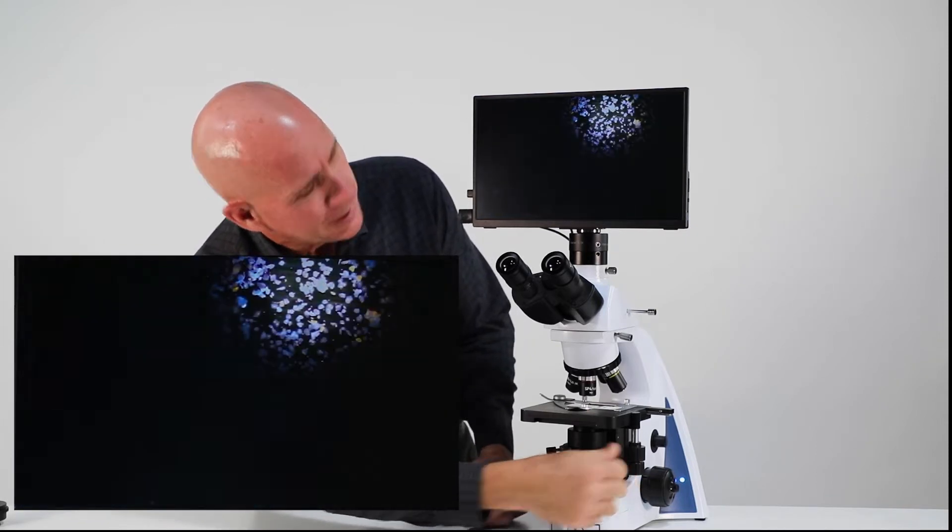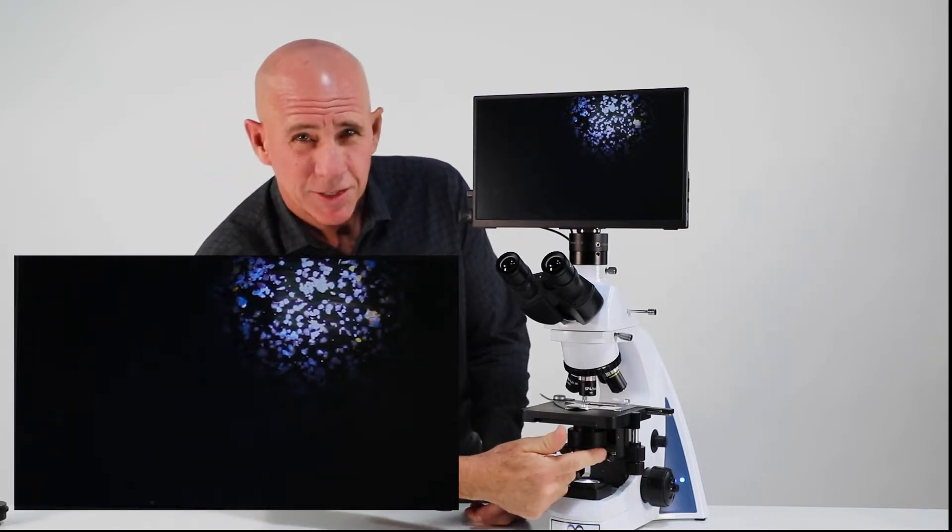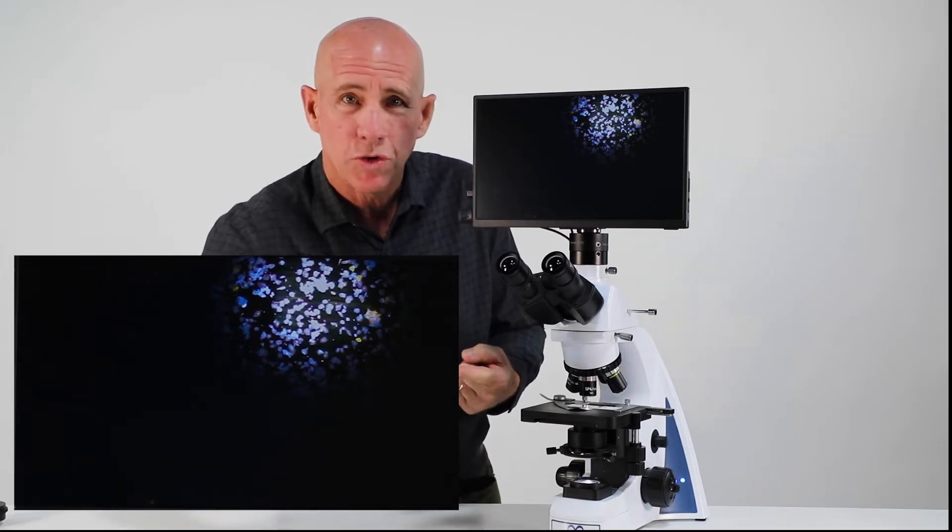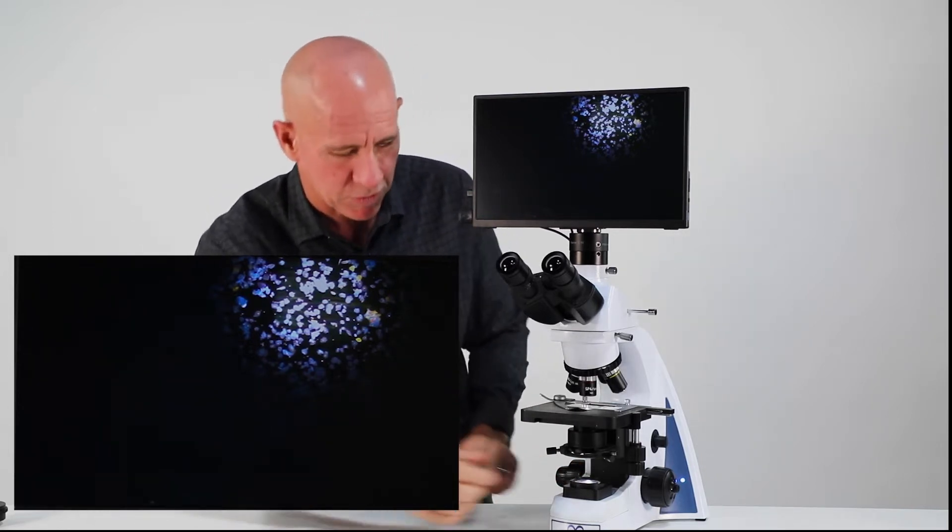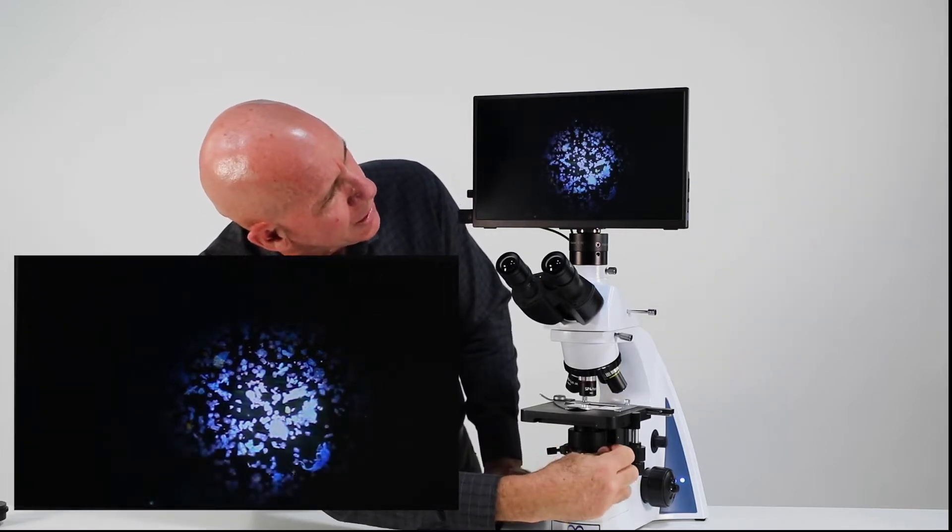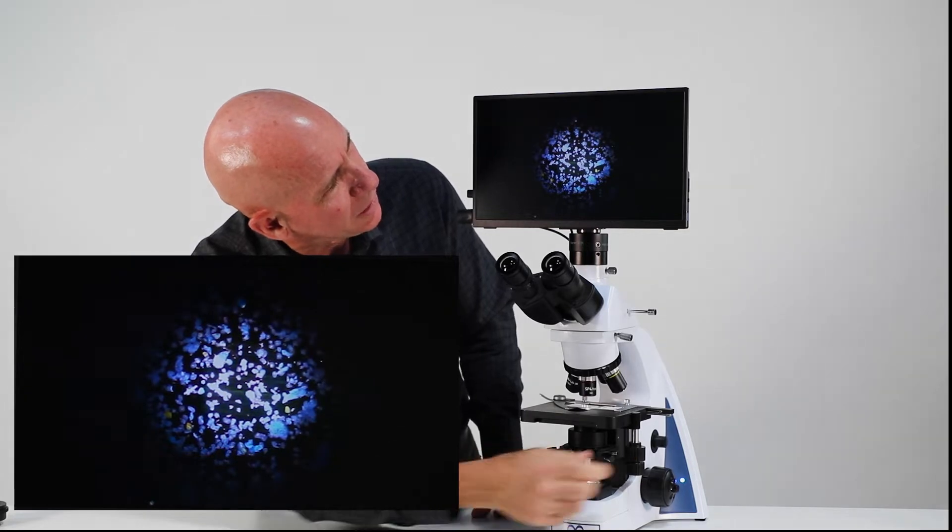So now I'm, basically these are, it's kind of like an etch-a-sketch where you've got a spring in the back pushing forward and you're controlling the front two of this triangle. So you're able to move this around. But once you find it, bring it in. So now I've just got it perfectly centered, just by a little trial and error.